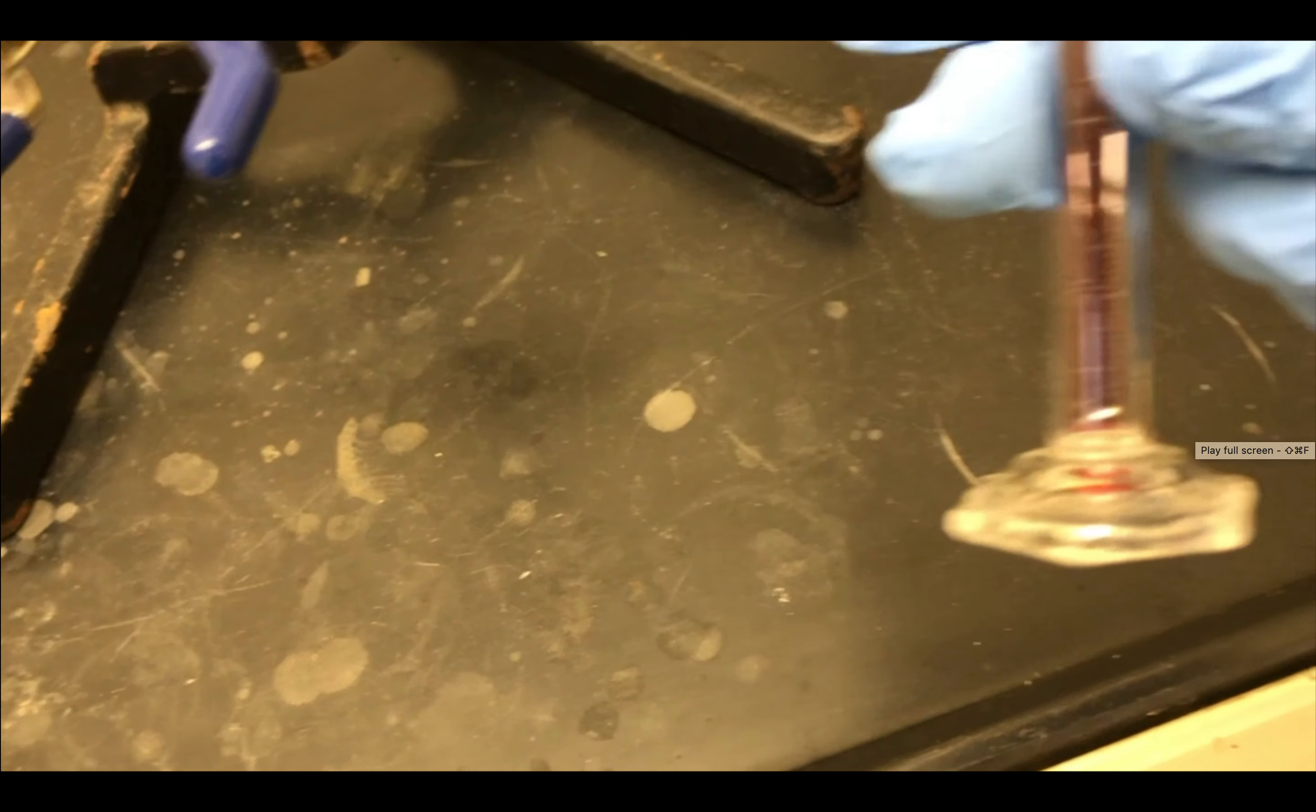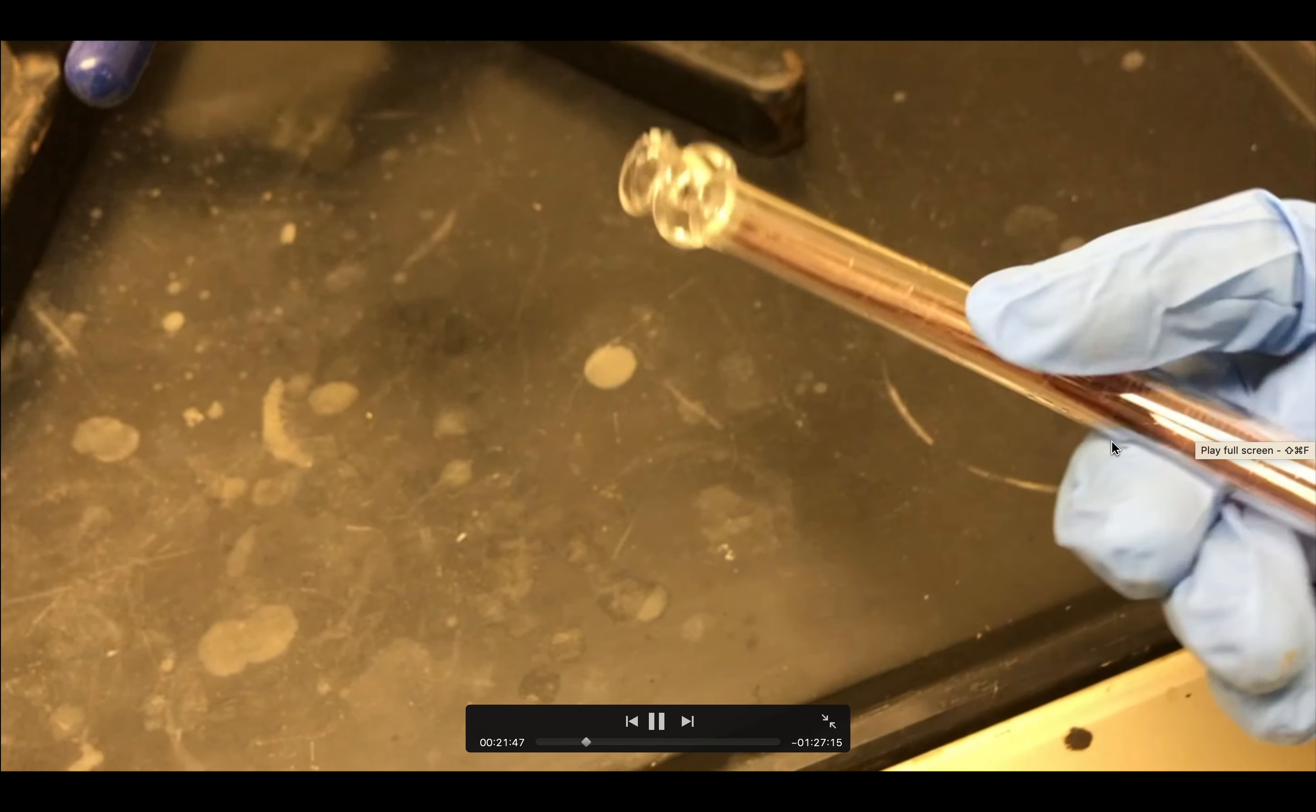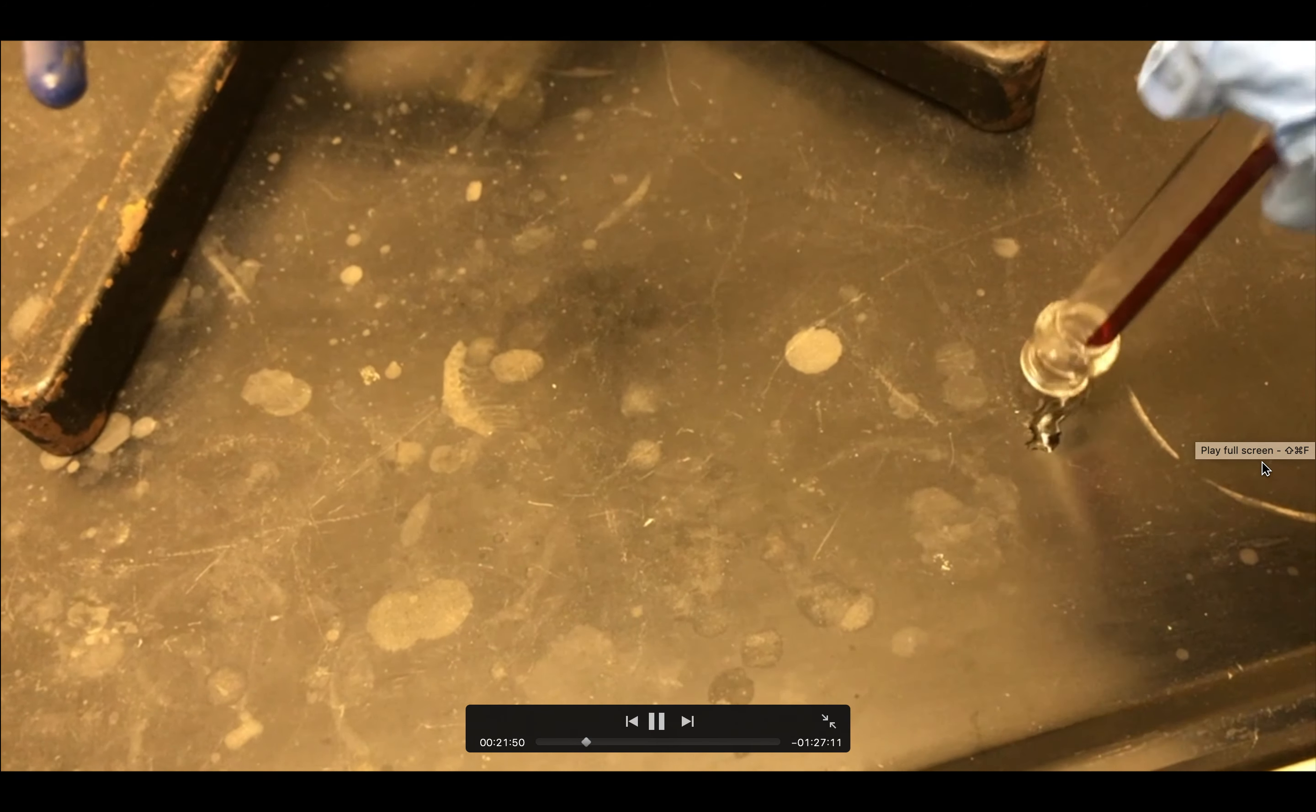And it's got a little more benzaldehyde in the bottom there. I'm going to pour it out inside of the fume hood, that little last bit of benzaldehyde, there it is.